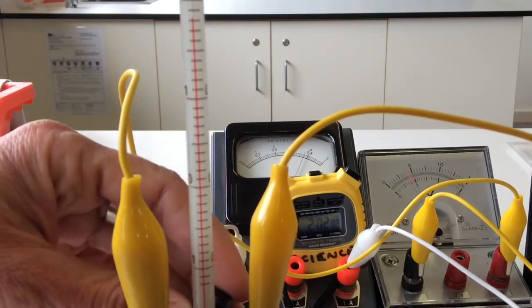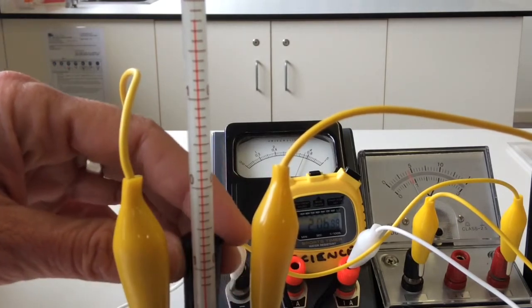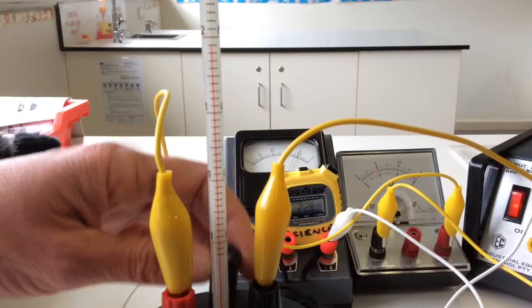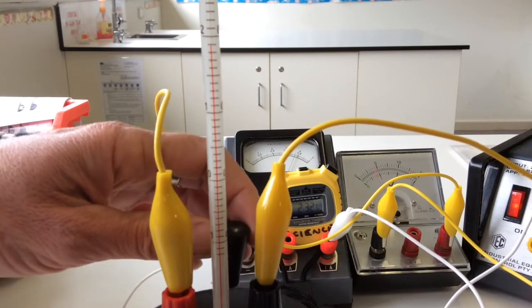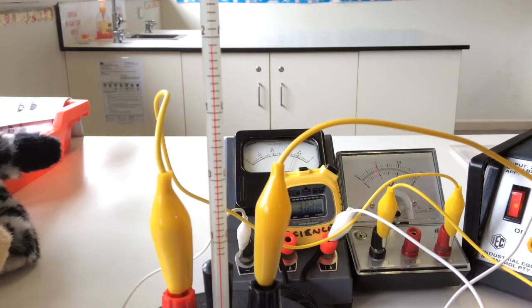Okay, so it's getting pretty close to the top of my screen, but remember, that's your 10. All right, 30 seconds to go before we hit the three minutes. Okay, there's your three minutes. I'll turn the power off.